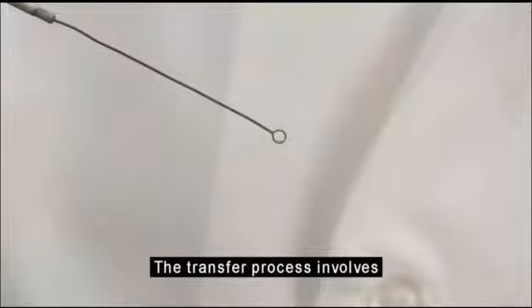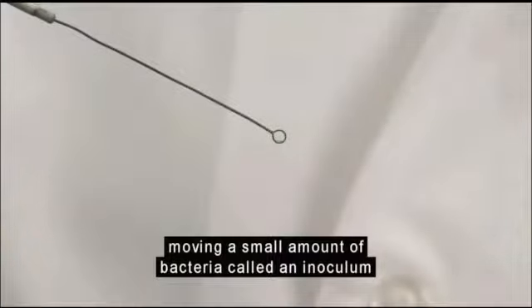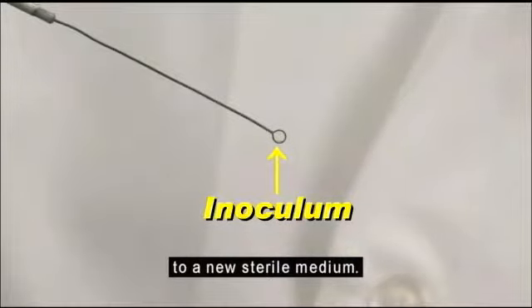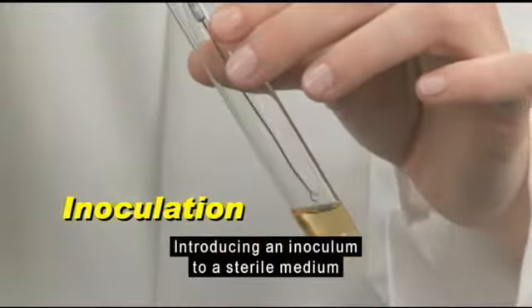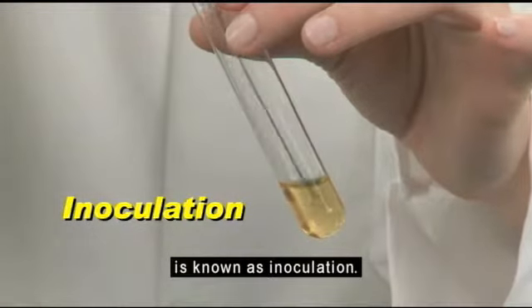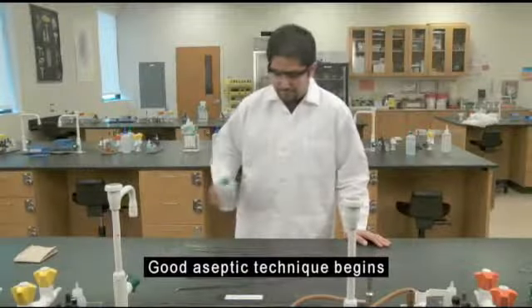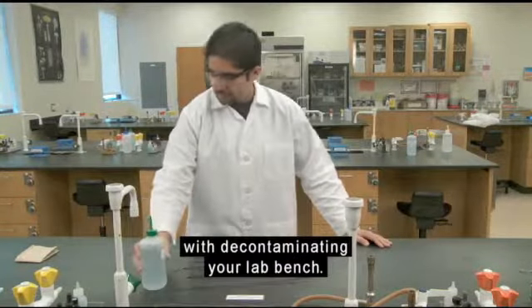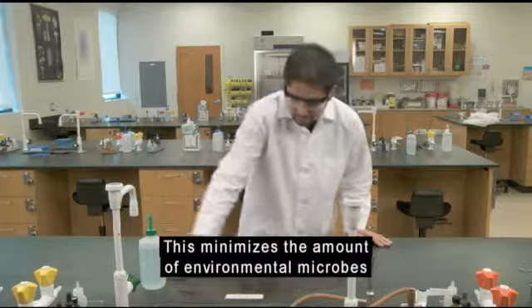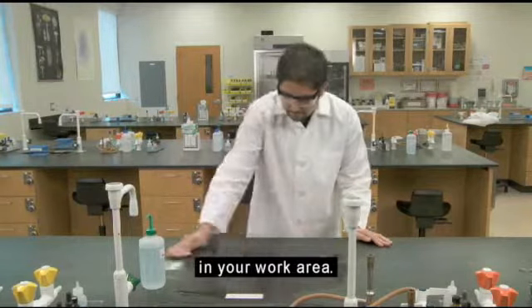The transfer process involves moving a small amount of bacteria, called an inoculum, to a new sterile medium. Introducing an inoculum to a sterile medium is known as inoculation. Good aseptic technique begins with decontaminating your lab bench. This minimizes the amount of environmental microbes in your work area.